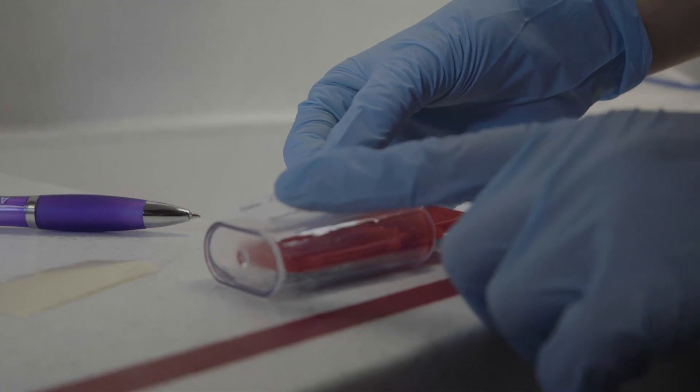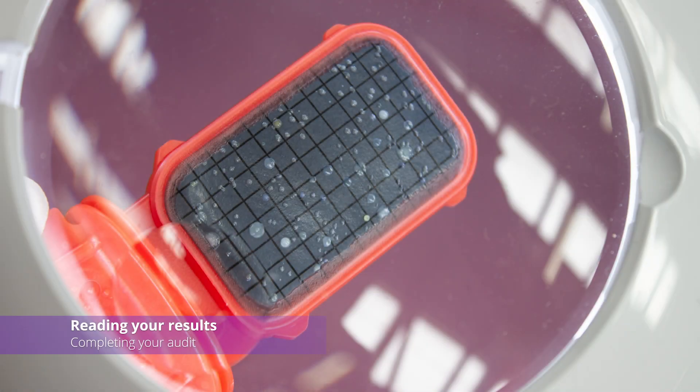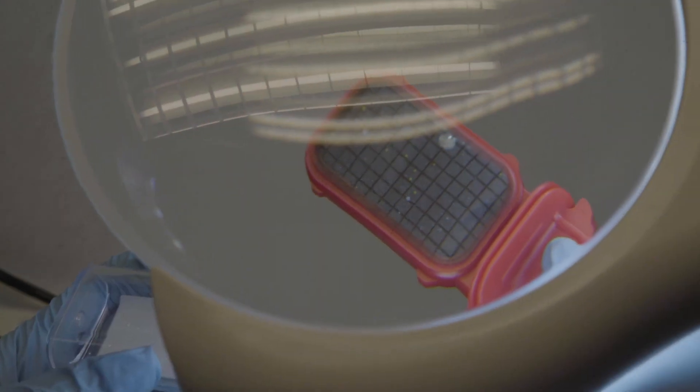Lay the sample red side up in a drawer or cupboard for 7 days at room temperature. Samplers should be read 7 days after performing the sampler test.